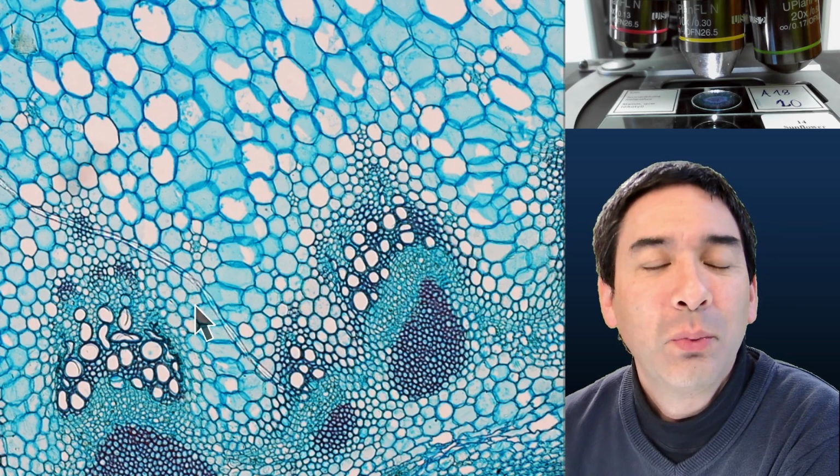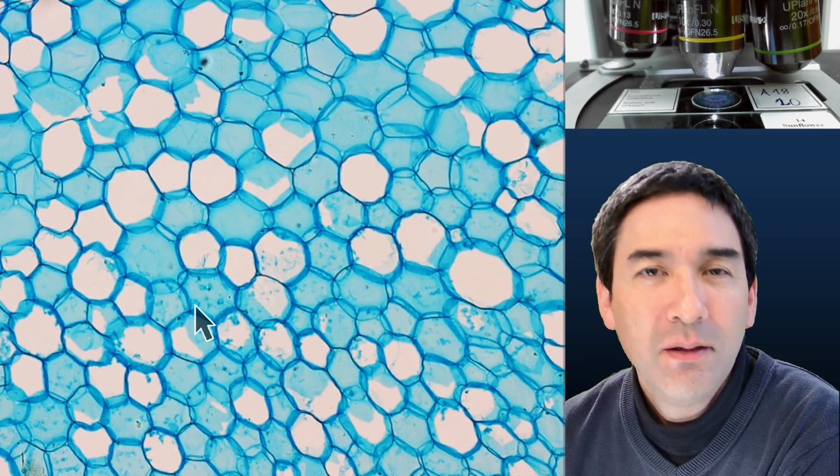Often you do not know the difference in advance, and I think that sometimes only a side-by-side comparison helps. But you see, even the more expensive slide over here has a little dust fiber in here. But overall, the quality is much better, of course. However, it costs 20 times as much.